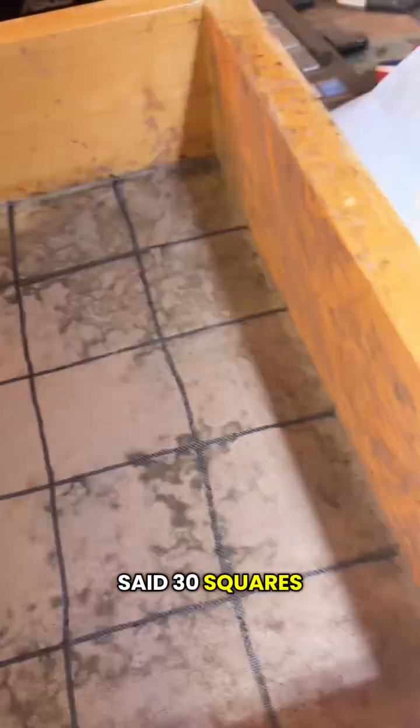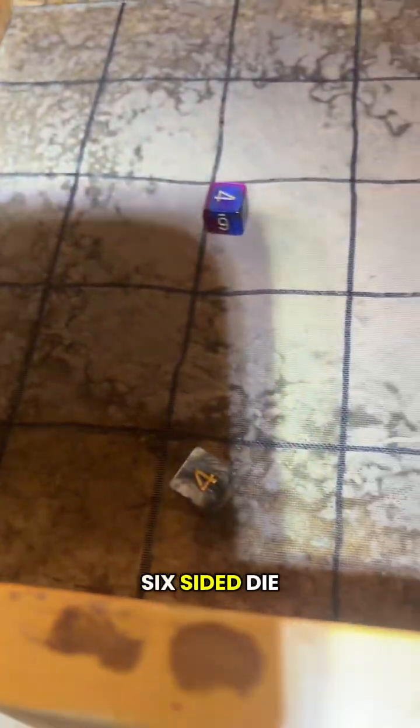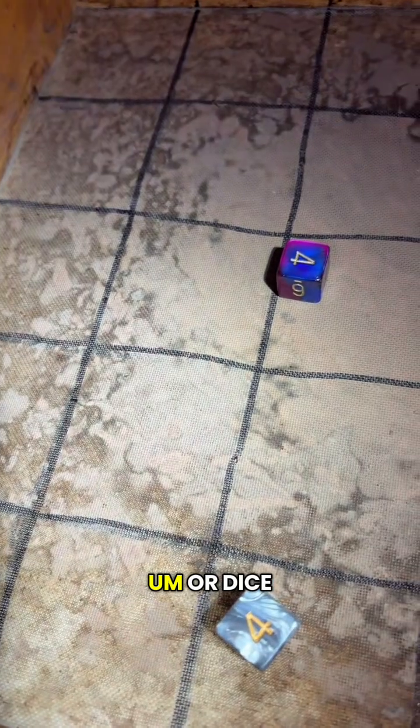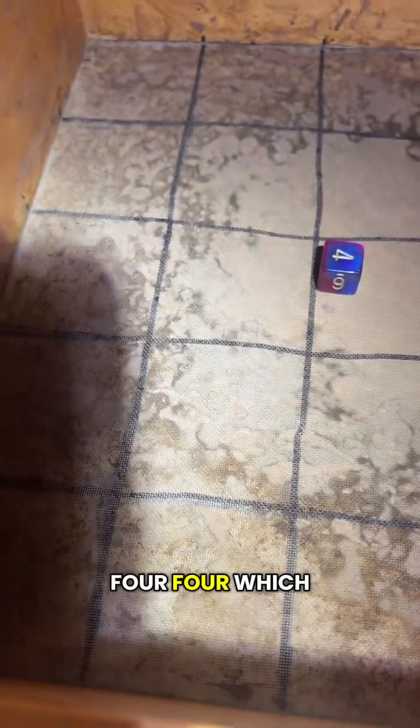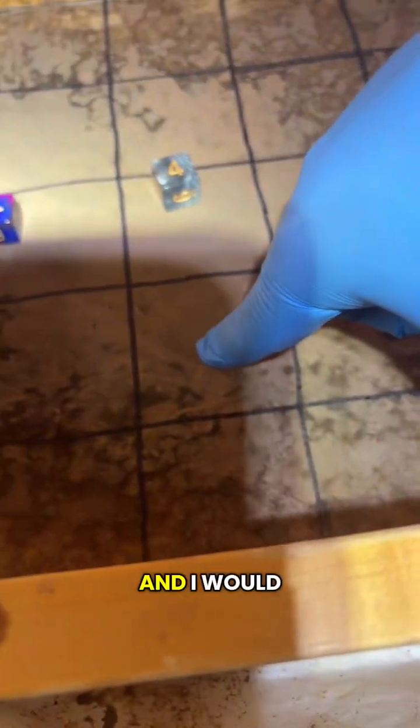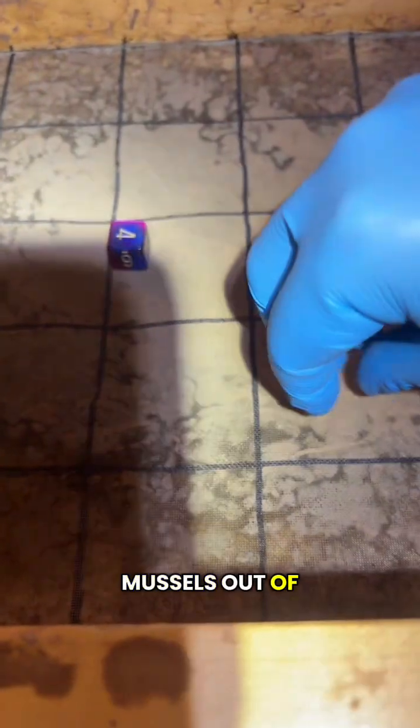So it's a 6x5 tray. So like I said, 30 squares. And the way that I select my mussels is by using two six-sided die, or dice rather. So like here, I would go to square 4, which is here, and I would get all the mussels out of that square.